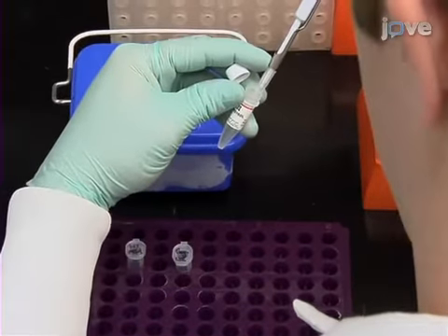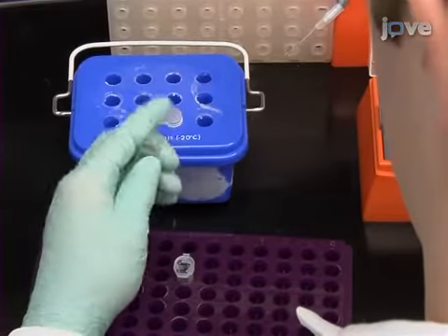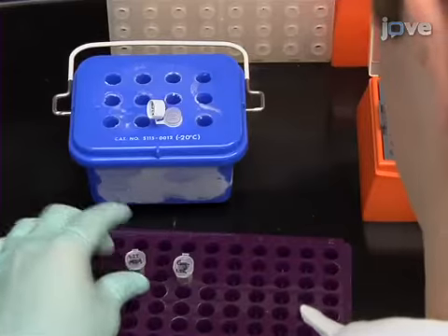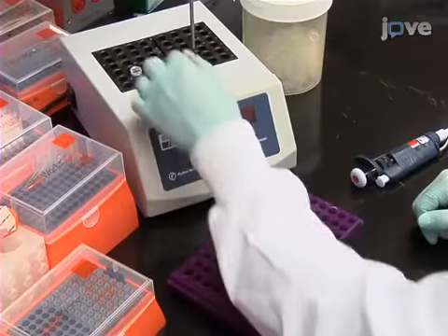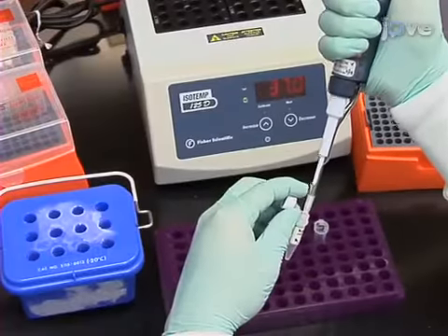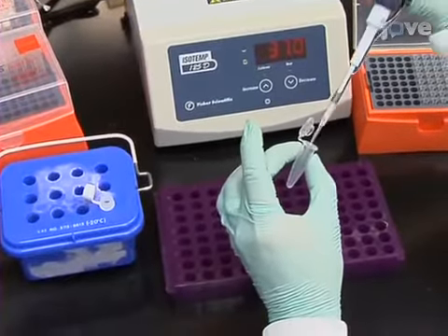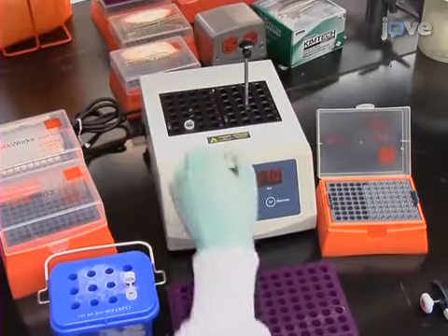Now, digest 1.5 micrograms of MJ4 plasmid and 1.5 micrograms of purified LTR GAG PCR product with BCL1 restriction endonuclease for 1.5 hours at 50 degrees Celsius. Subsequently, add 1 microliter of NGOM4 to the digestion reaction and incubate it at 37 degrees Celsius for 1 hour.